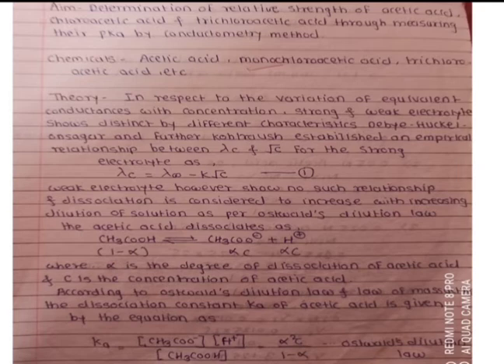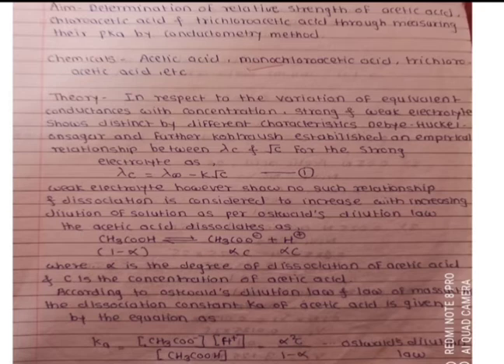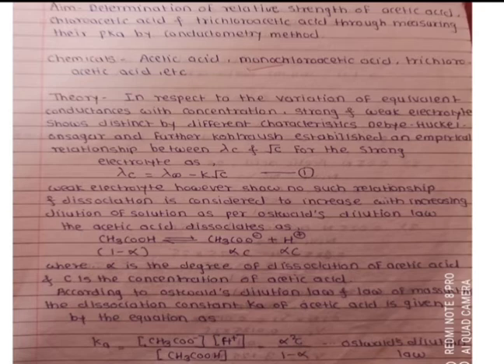Here is the protocol of the experiment, and now the photo of the experiment as written in the journal. You have to perform the experiment the same way, but do not copy readings from this protocol. You have to find out the strength of acetic acid and chloroacetic acid. In the previous year, students also performed trichloroacetic acid, so the journal includes it. But this year, we have to perform the experiment only for acetic acid and chloroacetic acid.